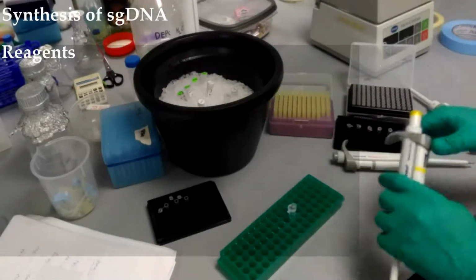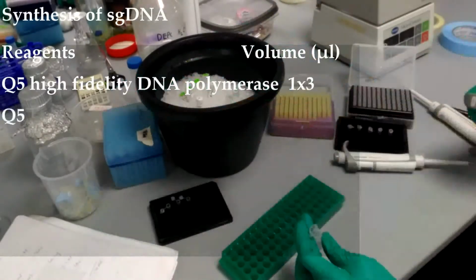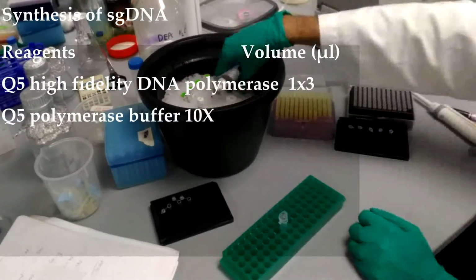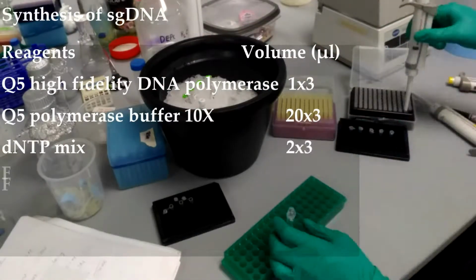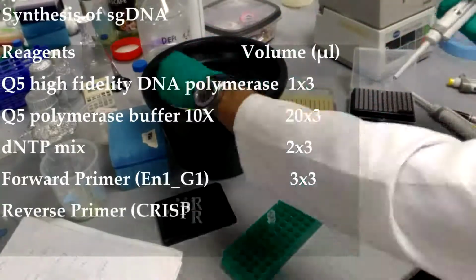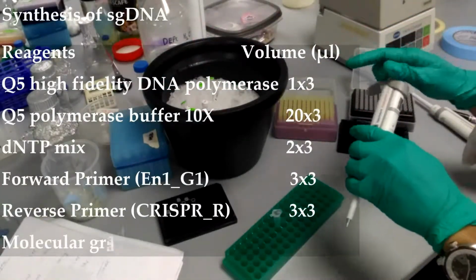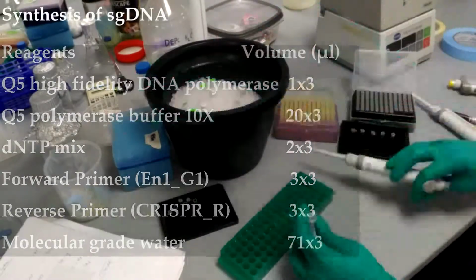Synthesis of sgDNA. To prepare sgDNA, in a 1.5 ml microcentrifuge tube, add 3 microliter of Q5 high-fidelity DNA polymerase, 60 microliter of Q5 polymerase buffer 10x, 6 microliter of dNTP, 9 microliter of forward primer, 9 microliter of reverse primer, and 213 microliter of molecular grade water.